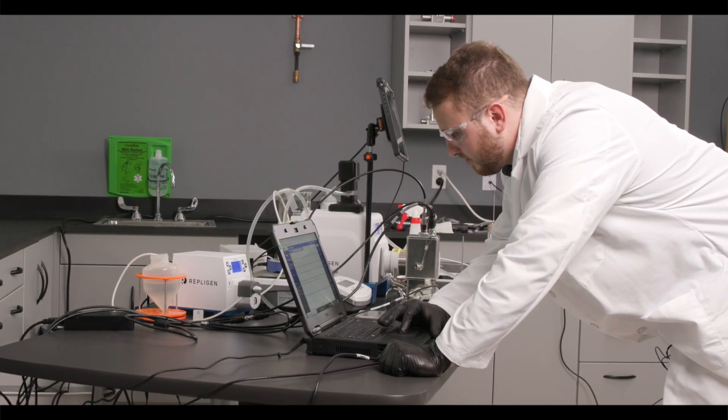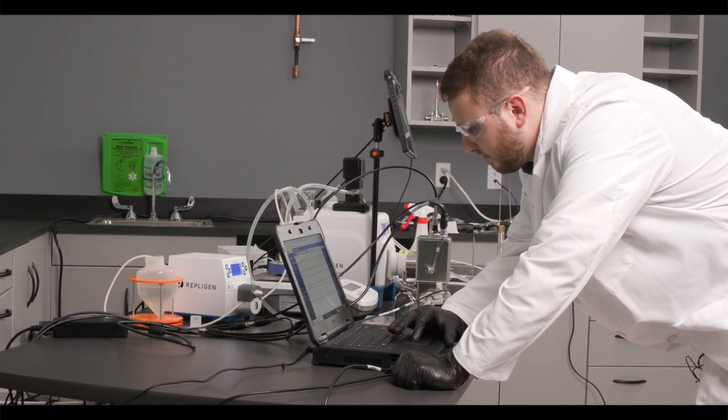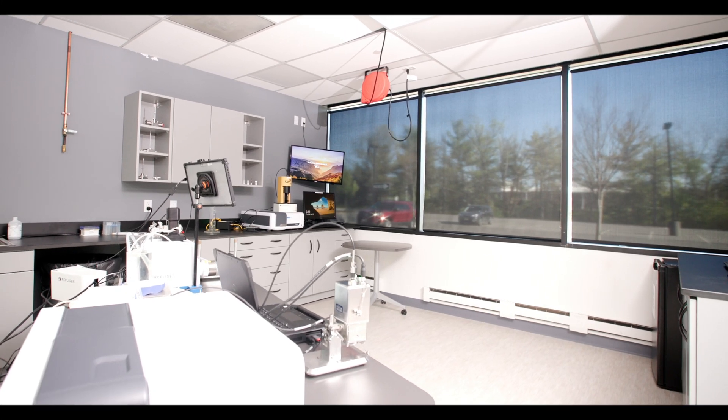To maintain your system's health, we recommend running a quick check before each run, running a coupler check weekly, and a system suitability test monthly. Frequency of the test may vary for different lab environments.